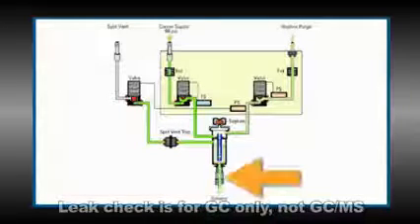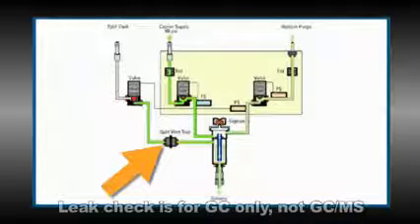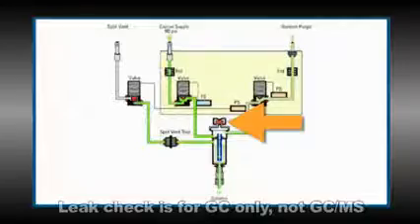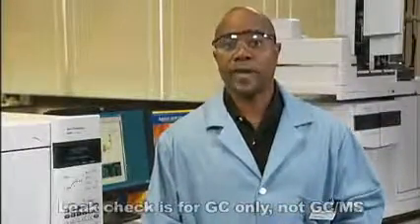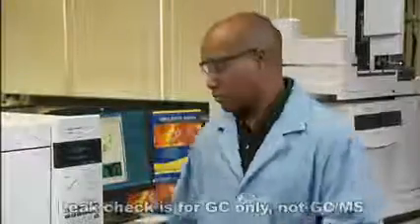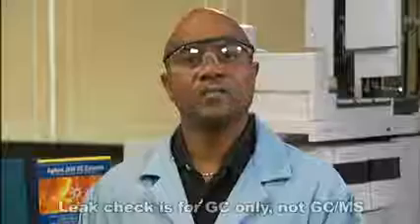It finds leaks at the inlet column fitting, the gold seal, the split vent trap housing and the vent line, the septum, and the septum nut. First, we need to check that the column dimensions are entered accurately into the GC. Next, set the inlet to splitless mode.